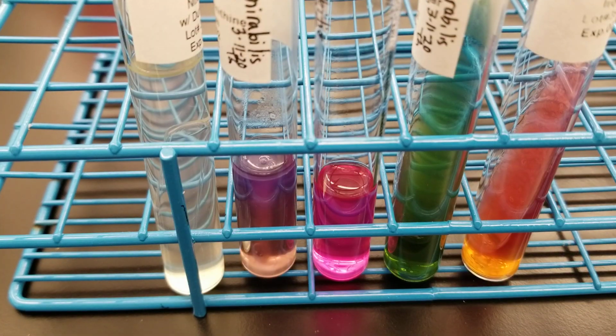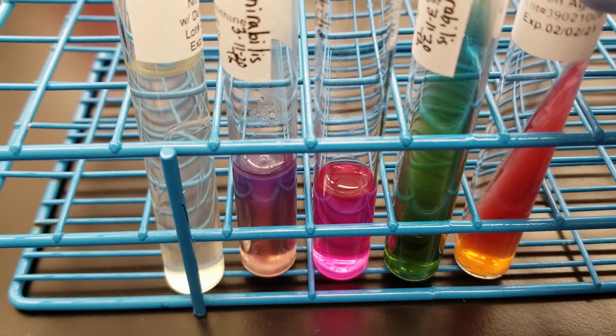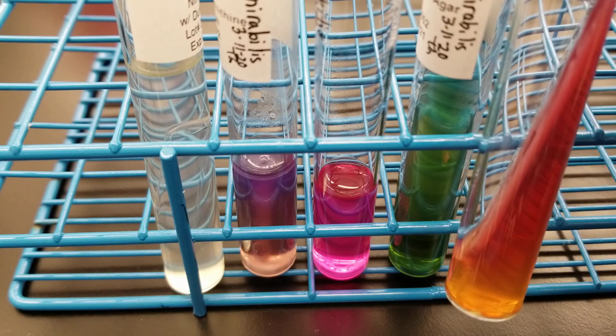Okay, now we're in the non-lactose fermenters that we have in class. This is an old strain that we have, and it's kind of finicky in the TSI slant. This is Proteus mirabilis, and you're not really seeing too much of a blackening at all here for the TSI slant.